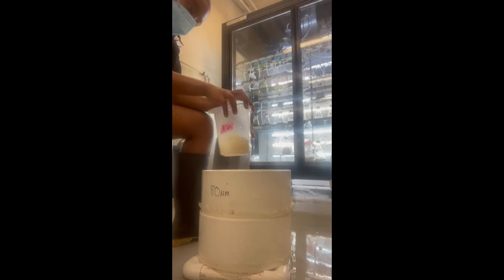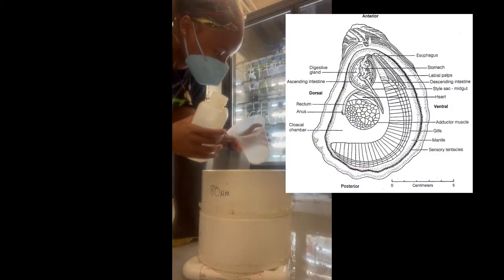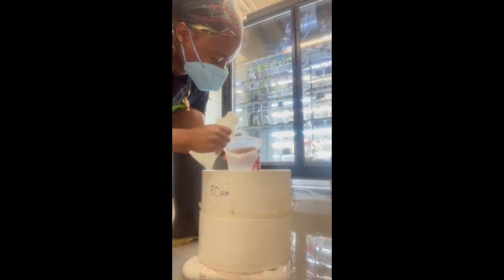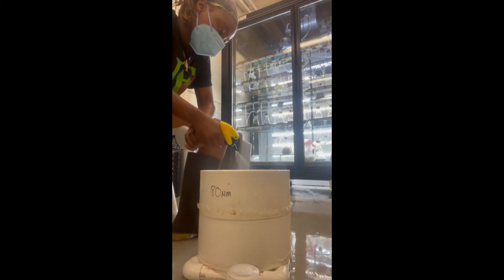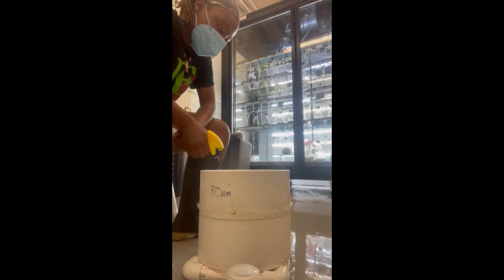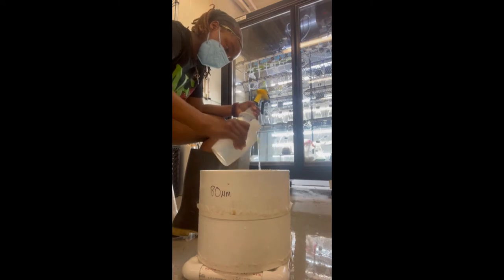What exactly are we separating? Since the oyster anatomy is quite small, the digestive area and the gonad area are in similar places, so when we're doing the stripping it is likely that we'll have some algae mixed in. We separate using sieves with different size netting on the bottom — larger netting on top and smaller at the bottom — so we catch the bigger material on top and what we want on the bottom. We spray and wash everything thoroughly to get all the cells we desire and make sure everything is properly separated.